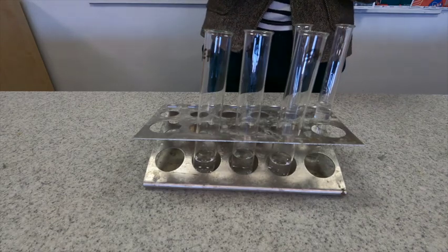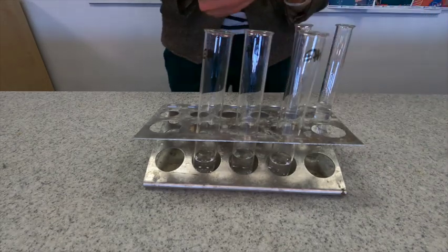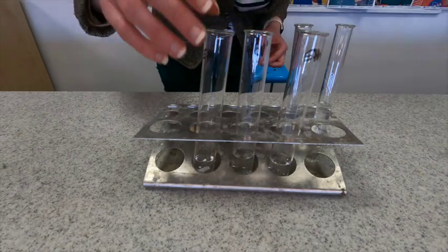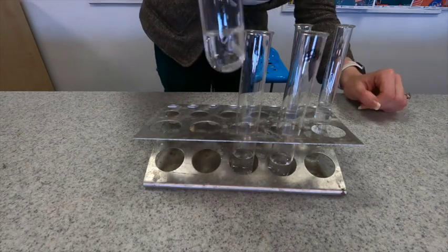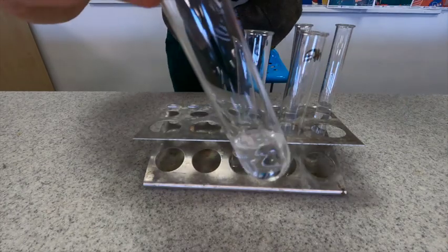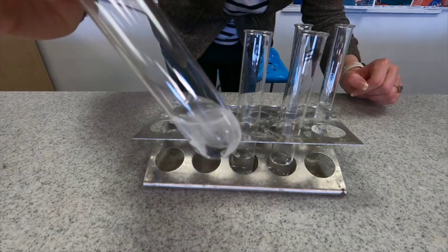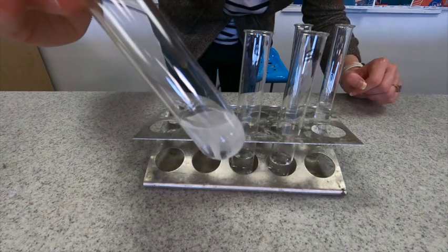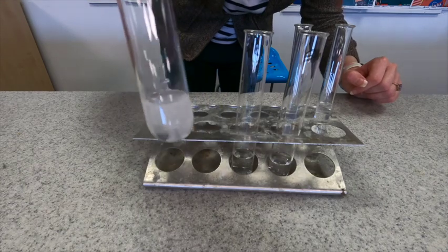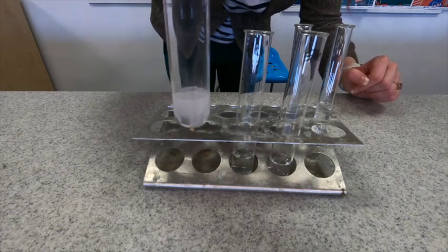Now I'm going to add in my two pieces of magnesium into my ethanoic acid and you can see straight away although there is some fizzing it is definitely less vigorous than it was for the hydrochloric acid. So it's much, much slower.